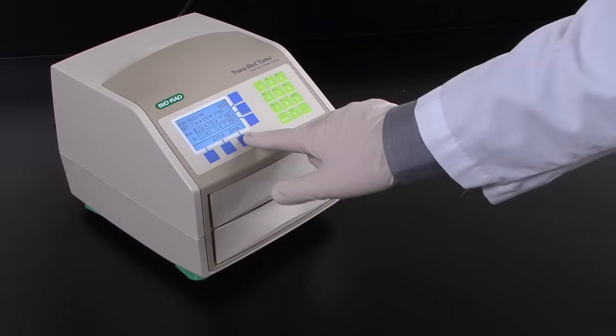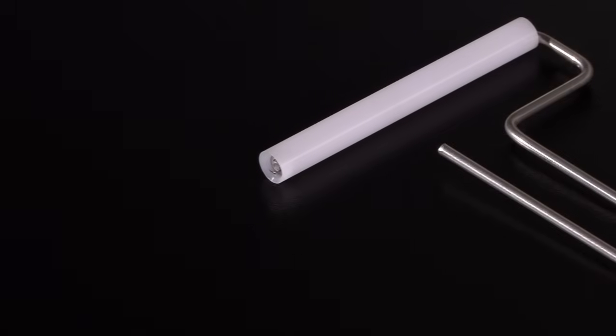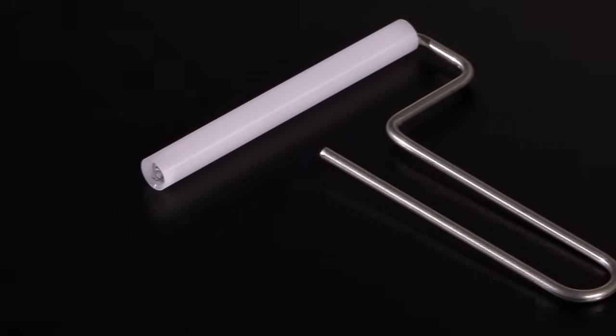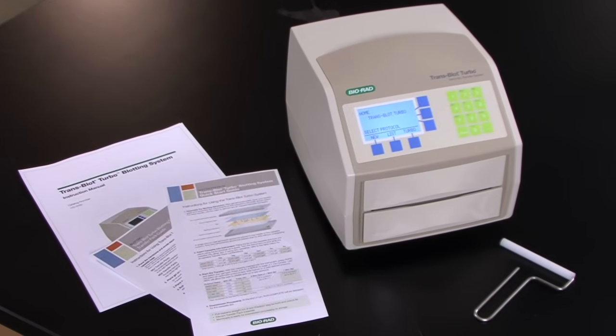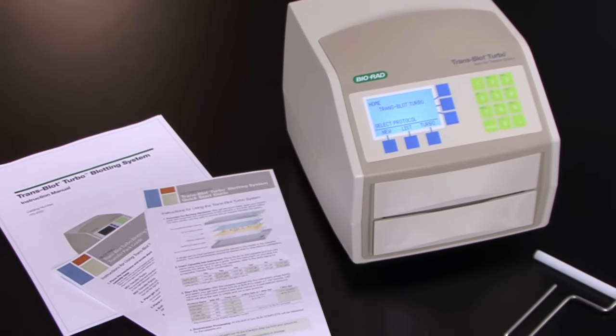The cassettes slide into the bays in any order. You will also receive a blot roller to remove bubbles that often form between the membrane and the gel, as well as a detailed instruction manual and a quick reference guide to help you set up the instrument.